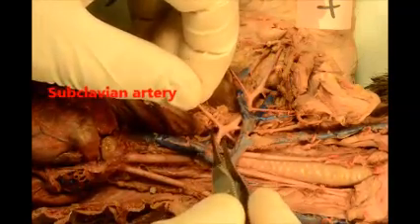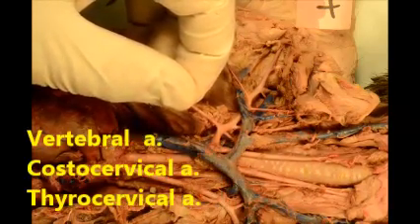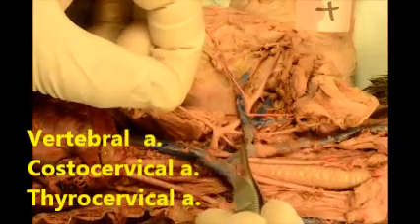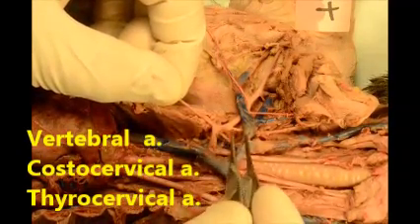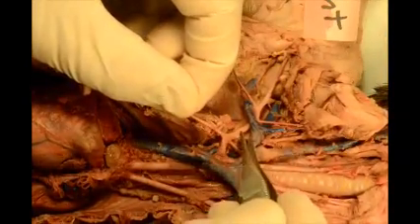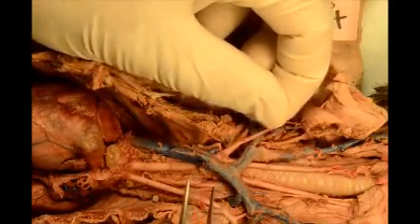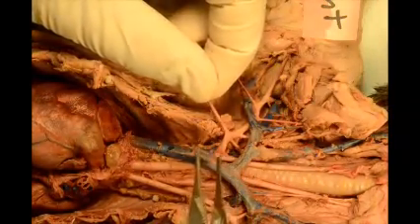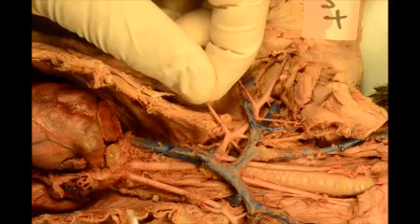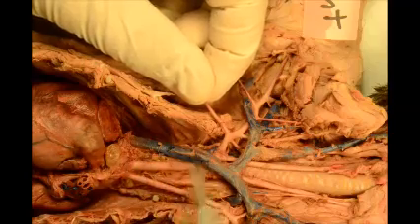The subclavian has four branches, but I refer to three of them as the VCT. VCT stands for vertebral, costocervical — which is this one here — and thyrocervical — which is this one here. The names refer to where they're going, and you can also remember them by the letters VCT because that tells you the order in which they branch off of the main artery.